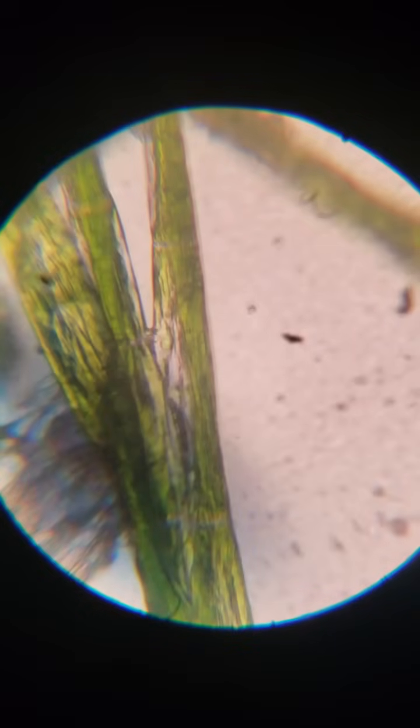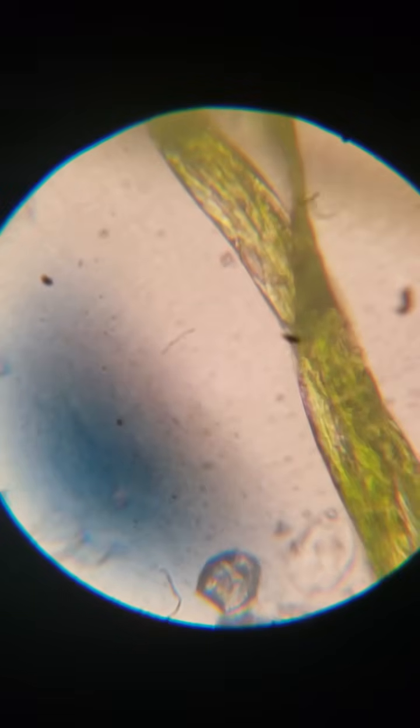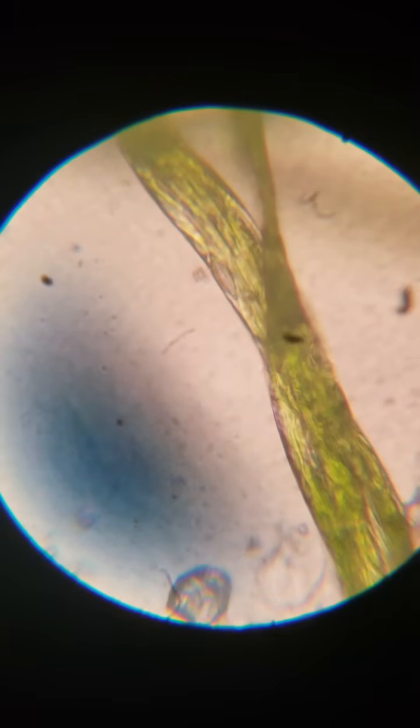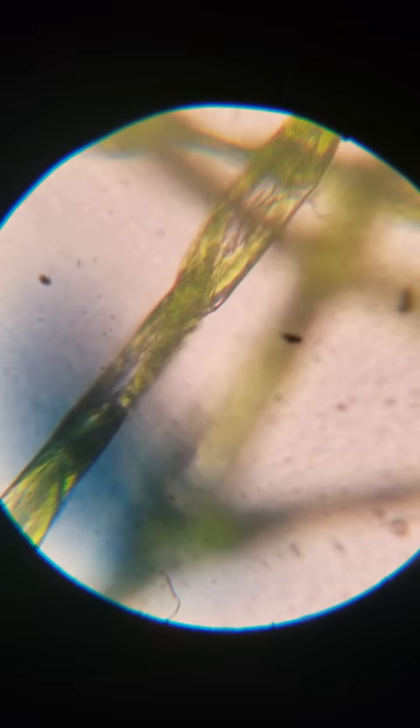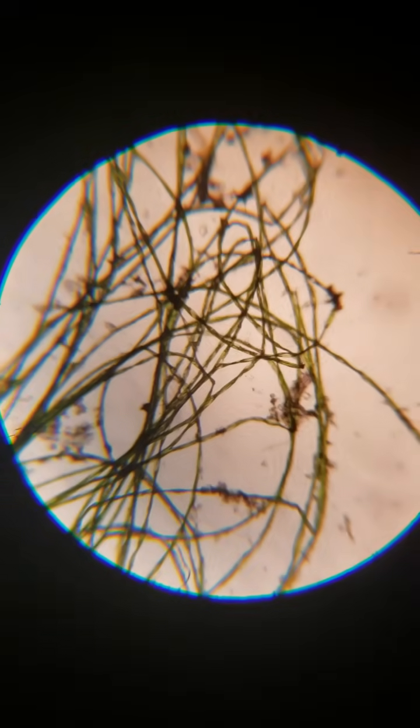With it, there's also some detritus and other cells of fungi and protists and all sorts of stuff. But right there, you can see the long, spindly algae cells, even as they're drying up. All right, so let's pop back over to low magnification, and we see our hair algae.